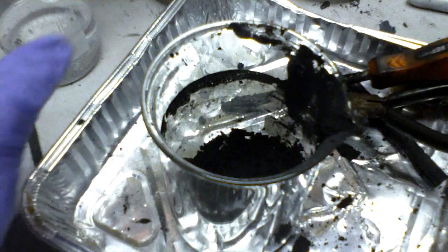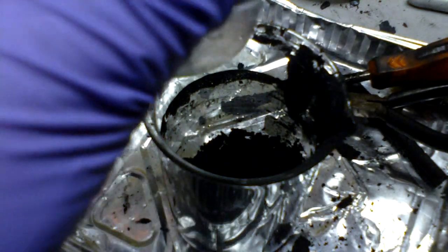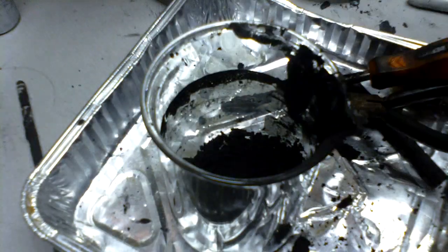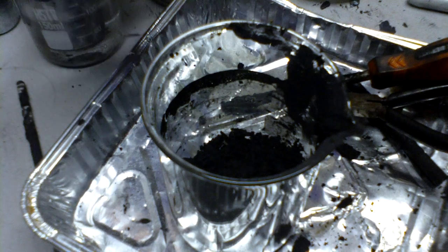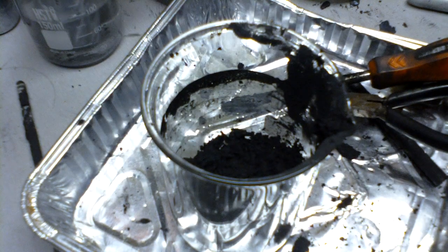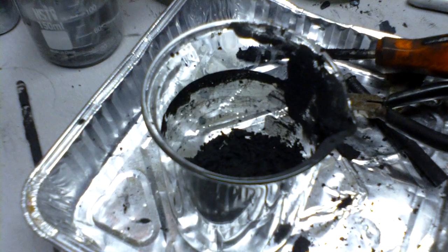Now since the zinc metal is pretty hot, I'm gonna submerge it in a beaker of water, cool it off, but not leave it in the water for too long or else it'll start to oxidize. So I'm gonna pull it out as soon as it cools down.